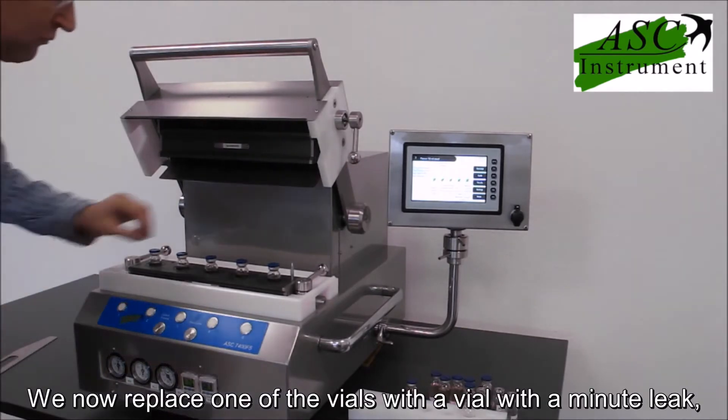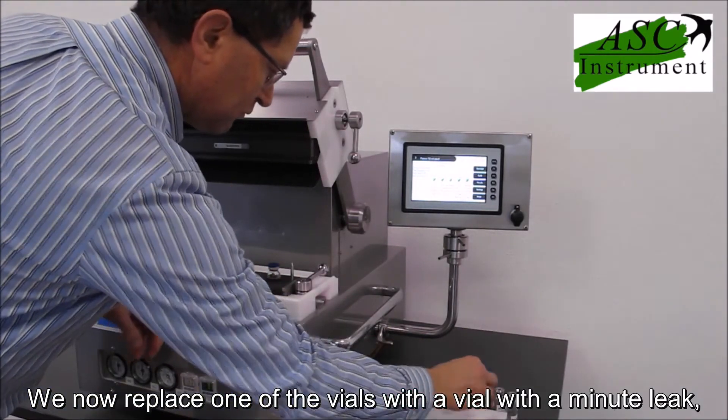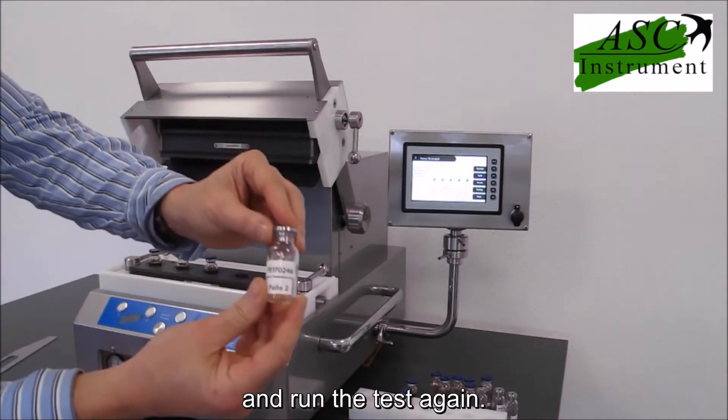We now replace one of the vials with a vial with a minute leak and run the test again.